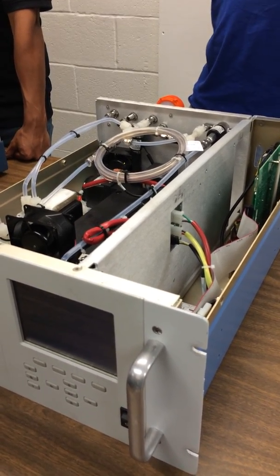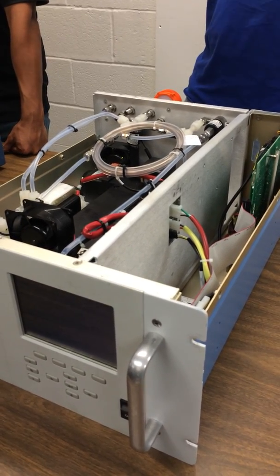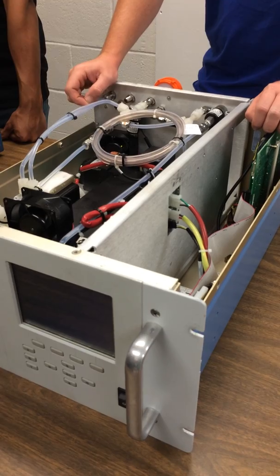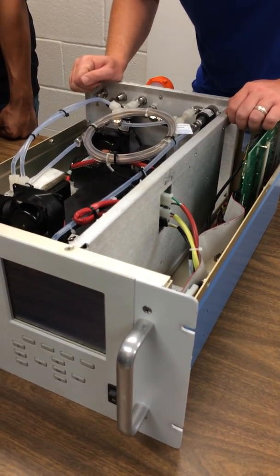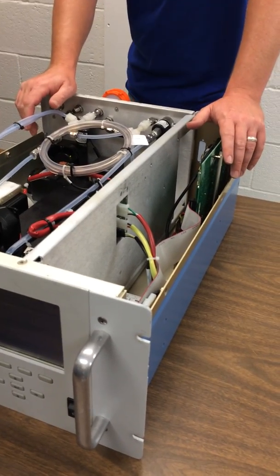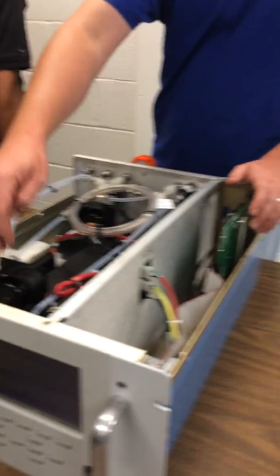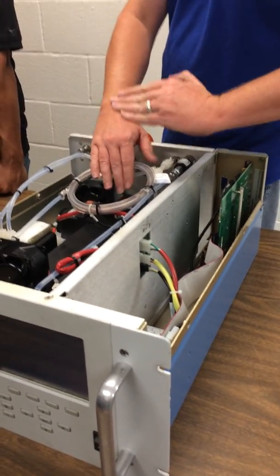Overlaid on that is a chopper. So there's these blades that go through it so it can get pulse measurements, so the light comes in and measures it. It's fast enough that you get several measurements from each cell for each revolution. And it spins 1,800 RPM, so it's fairly fast. The light comes in. This is an angled mirror here. It actually makes 4 passes off of the end reflectors before it reaches another mirror under here that's angled upwards.